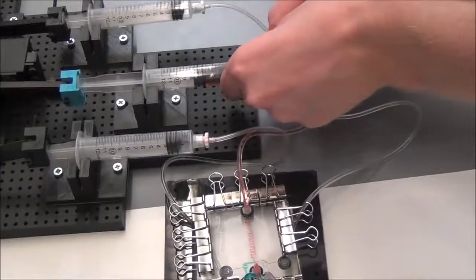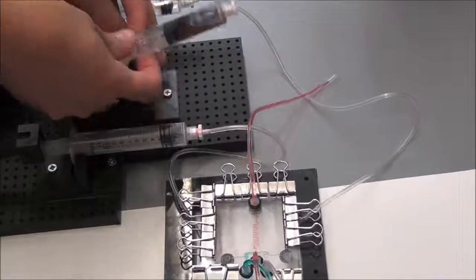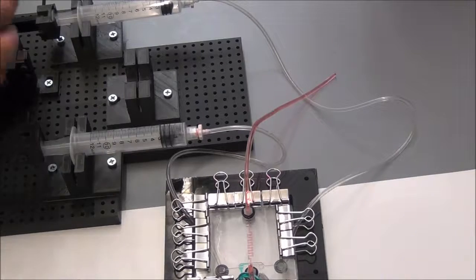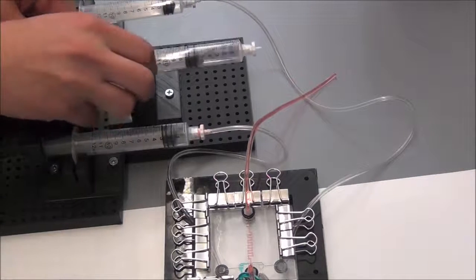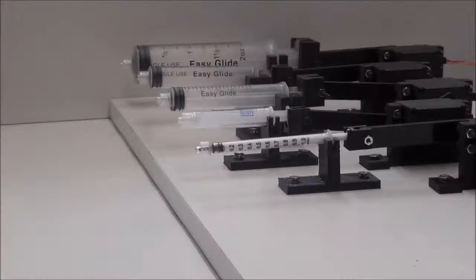Changing the setup is easy. To change syringes out with one another, simply snap out the syringe from its holder and snap another in its place. No unscrewing components from the board, and no mess. Just as Neptune worked for Dr. Ali's experiment, Neptune's hardware is adaptable to a huge number of unique experiments.